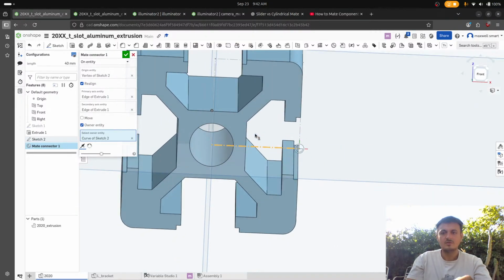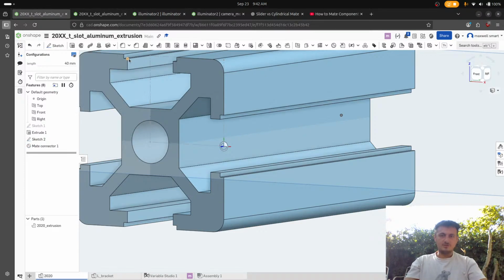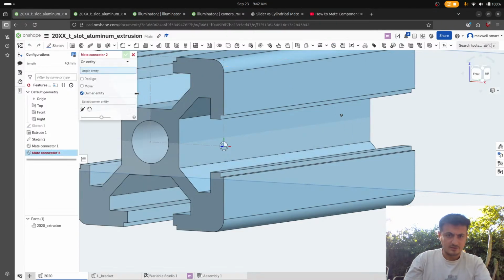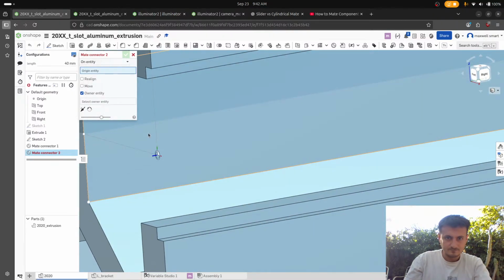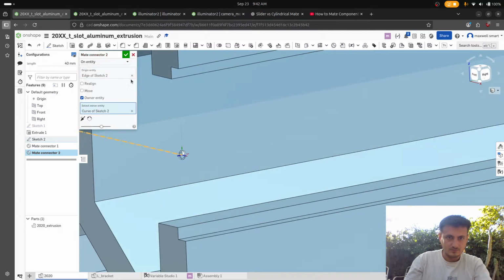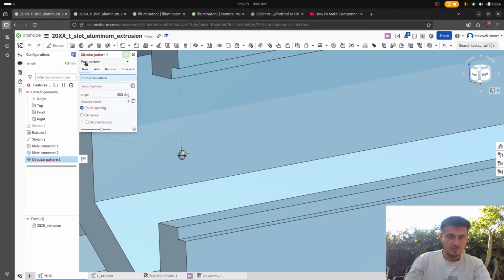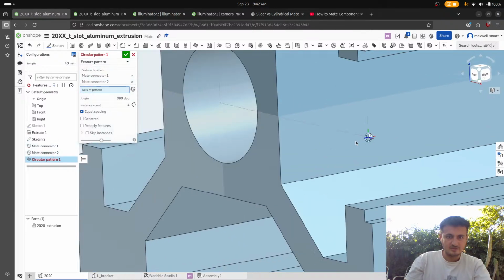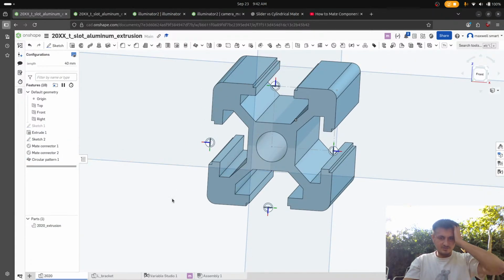So now, I don't even know why we're doing that one. That one doesn't even seem that useful though. But no matter. I'll just do it. Okay. And then circular pattern. Part pattern, feature pattern, face pattern, axis of pattern. Okay, cool. So that should be somewhat useful.